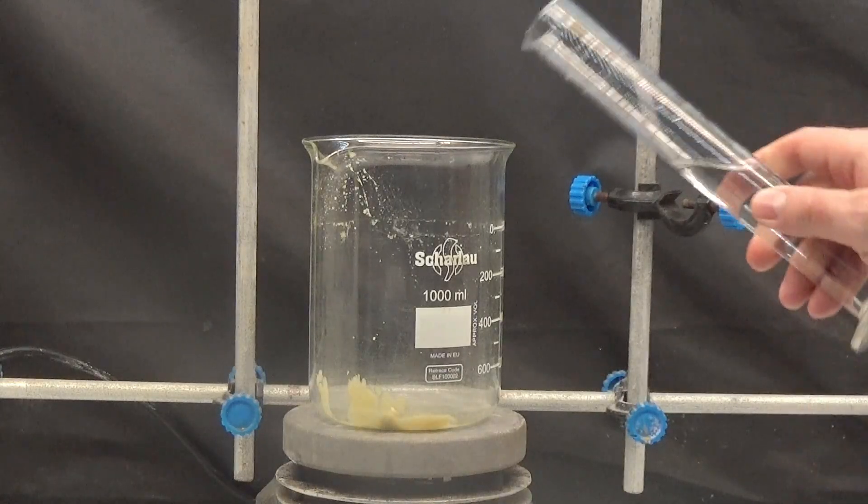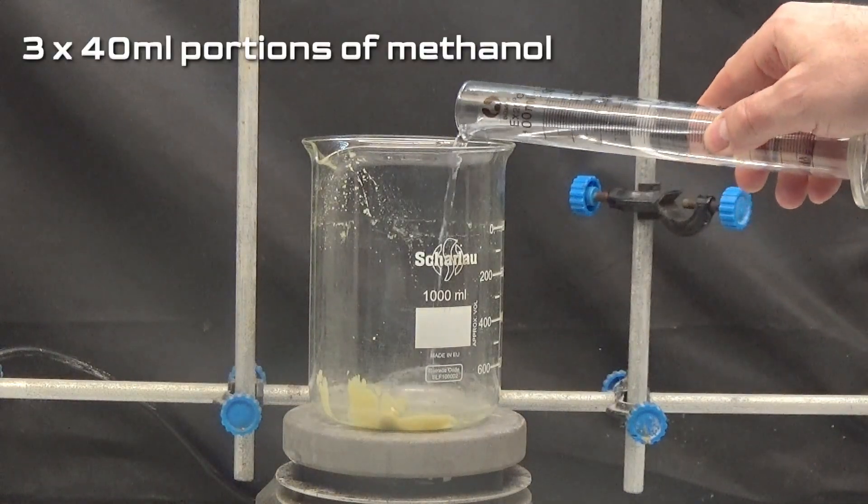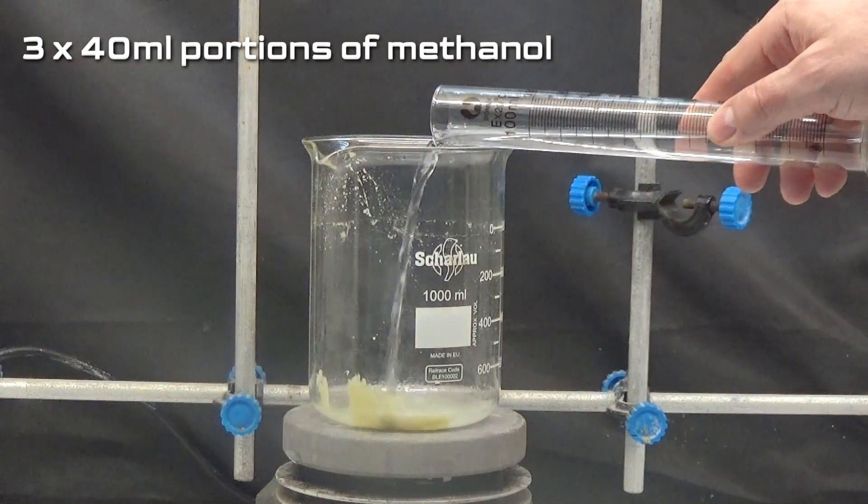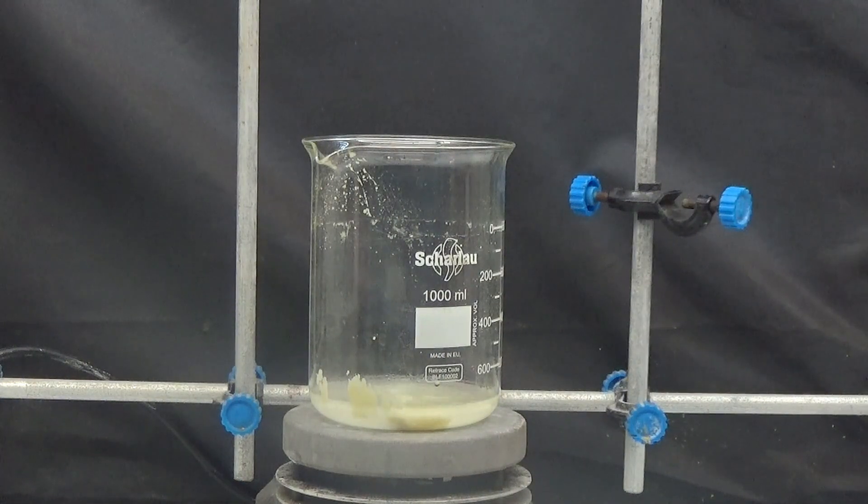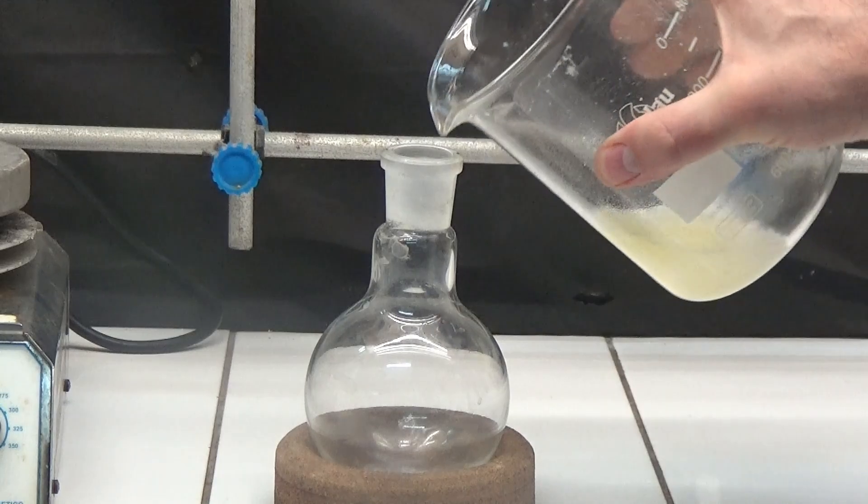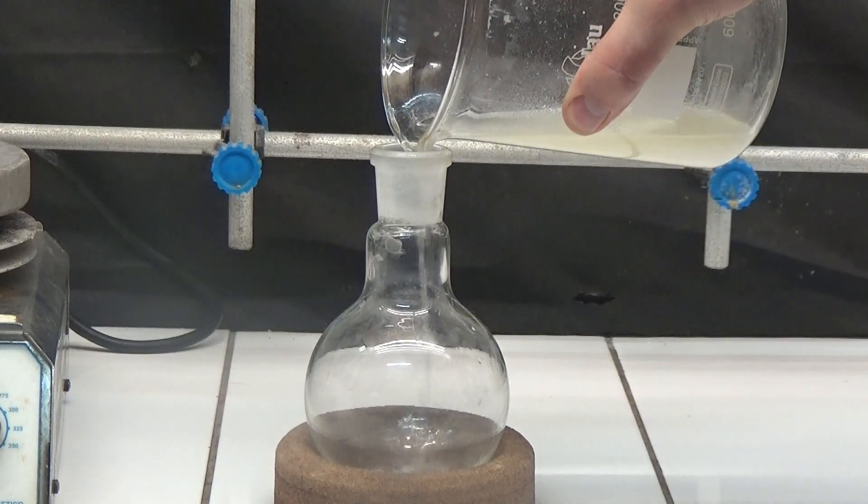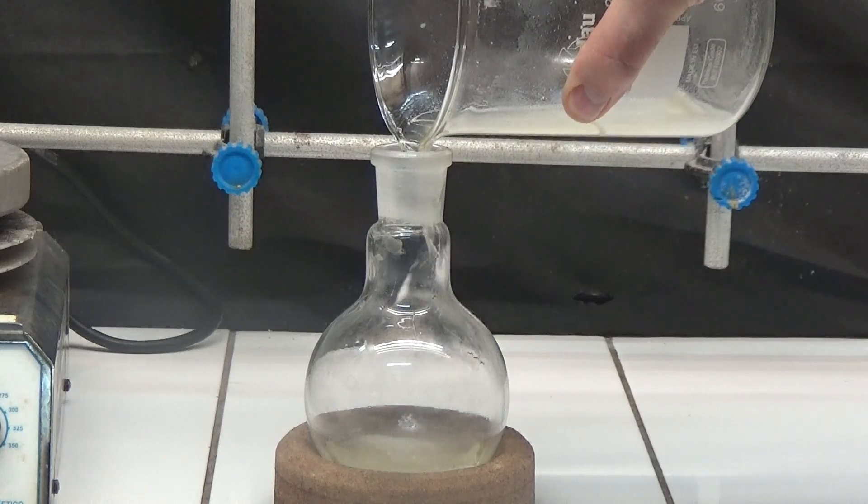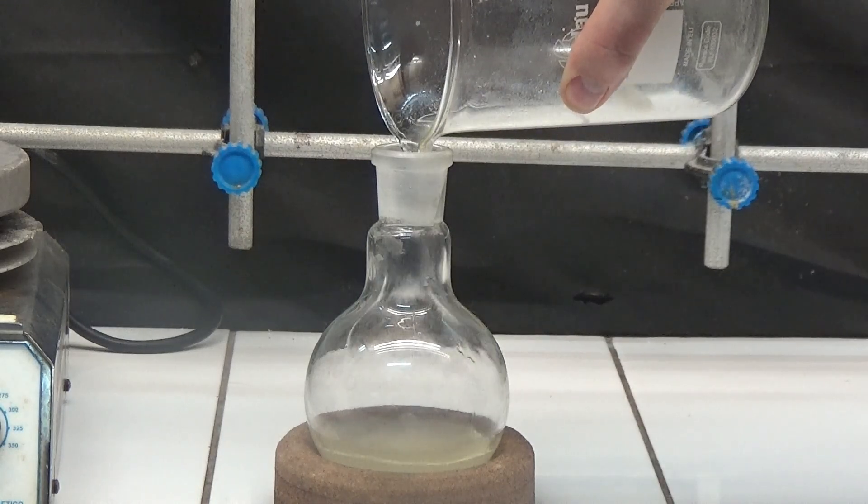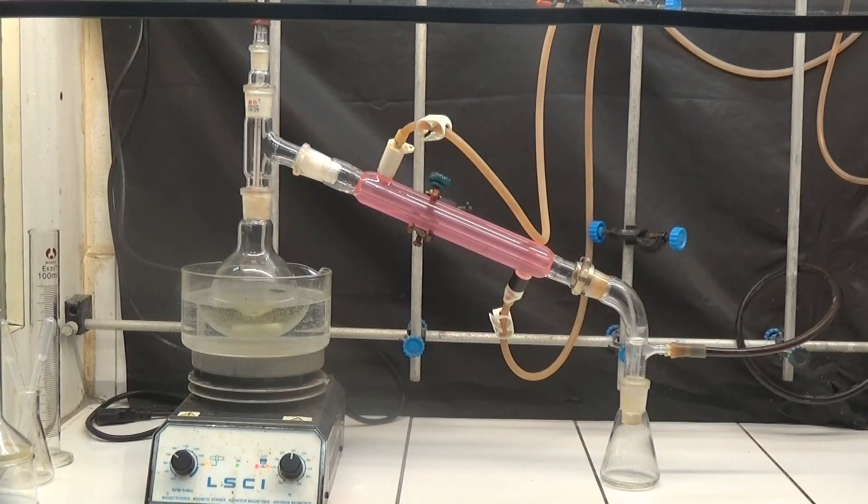To collect all the washed paste, dilute with 40ml portions of methanol and put in a 250ml distillation flask. Distill all the methanol by simple distillation at low pressure in a hot water bath.